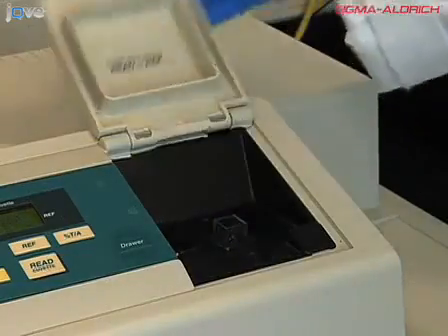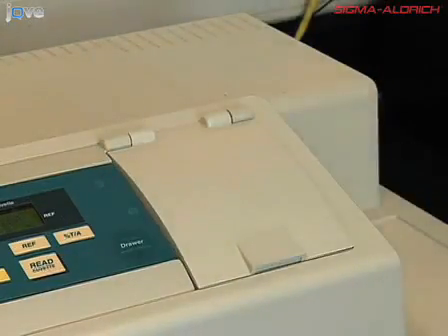Today, I will show you a universally applicable way to test protease activity. At Sigma-Aldrich, we mainly use this assay in our quality control area to ensure that our protease has sufficient activity before we ship it directly to you at your lab.